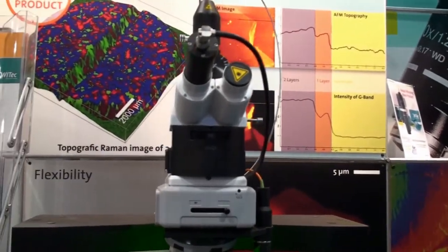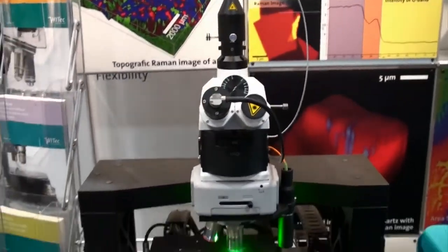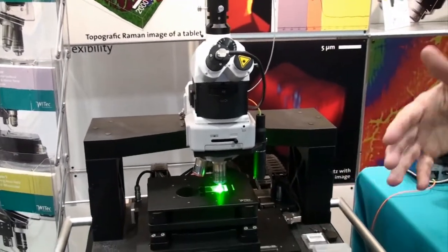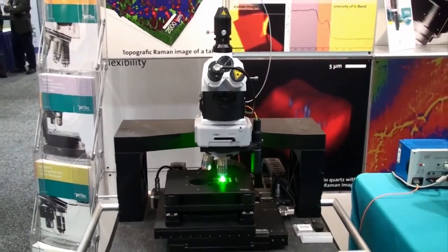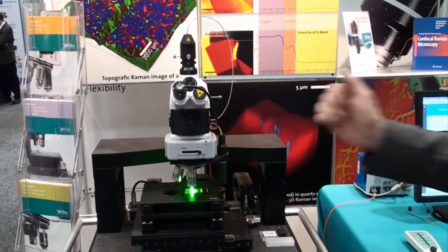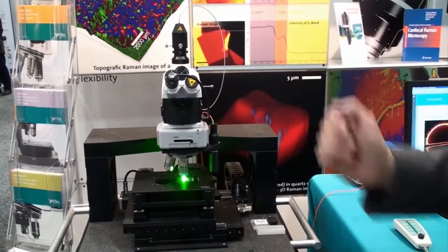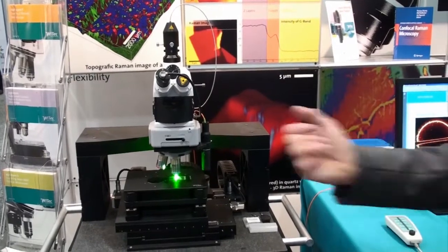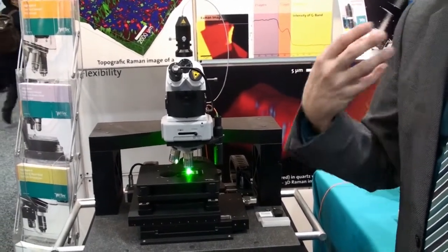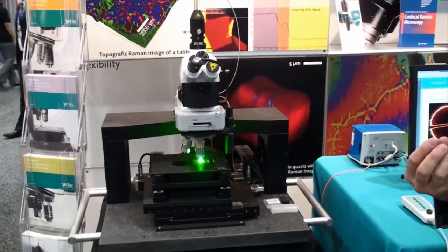With this system we take a complete Raman spectrum at every image pixel — typically 100 by 100, or 200 by 200, or even more pixels per image. That gives you a number of up to 100,000 or even more spectra per image. From every spectrum you can then calculate or display the different components of the sample.